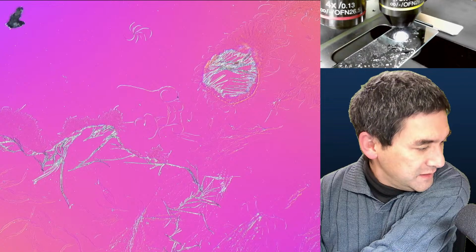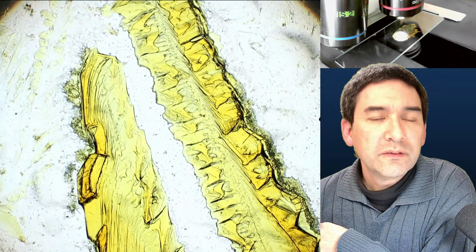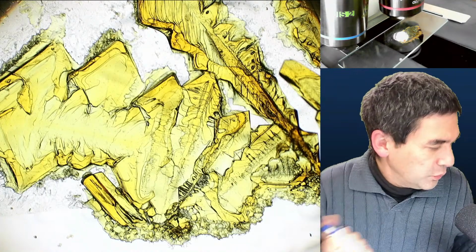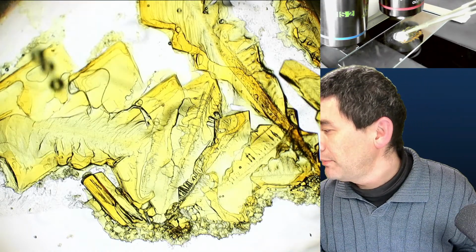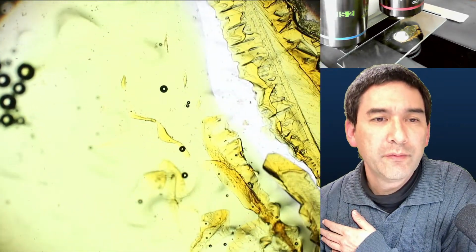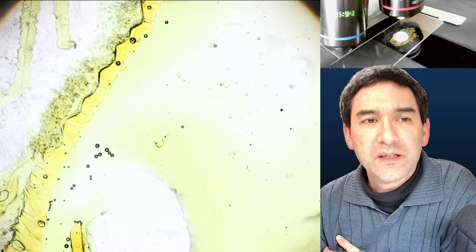So this was salicylic acid. Potassium ferricyanide, it's also a nice one. Looks nice and red. Nice and red over here. This one, I think we can even use crystals here. Look, yellowish. That's not in polarized light now. And here too, I think this dissolves better in water. Let's add a little bit of water and see how this works. Again, blip. However, this might take a significantly longer time to recrystallize because the water takes more time to evaporate.